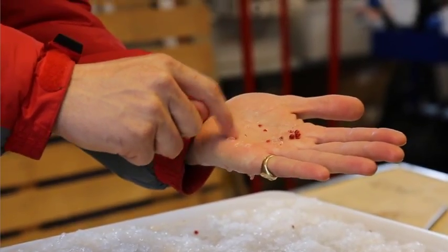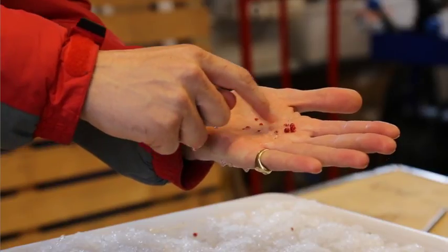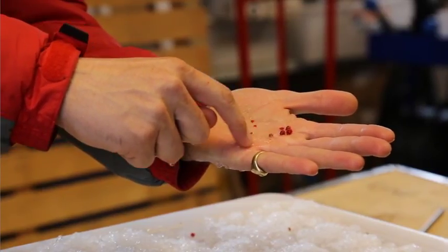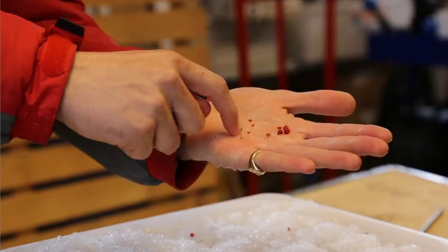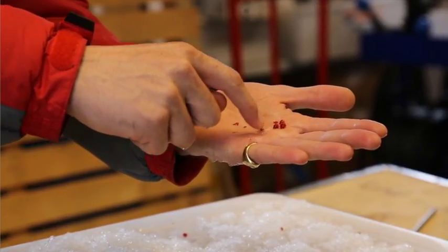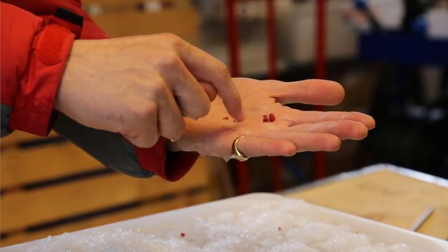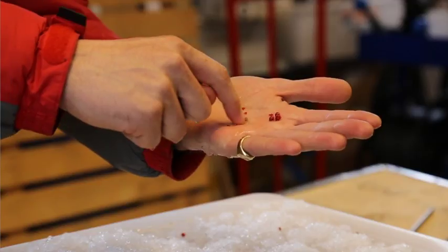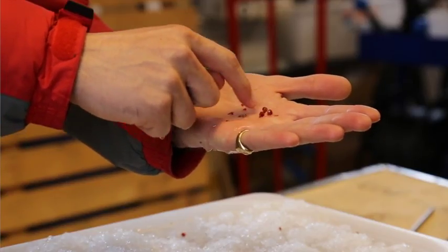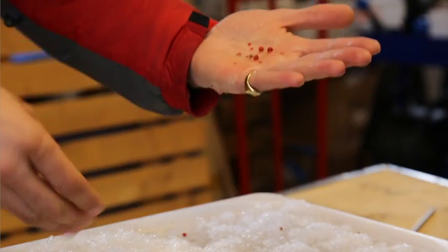Of course, please use some filter paper. Put your ice core samples on filter paper if you're doing this in the classroom with us. You can also, rather than using hand warmth, put your ice core samples into a test tube or boiling tube and warm those using whatever equipment you have. That might be something as simple as a hairdryer or using a Bunsen burner.